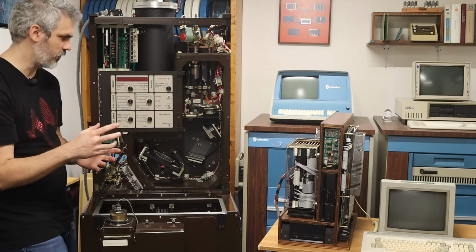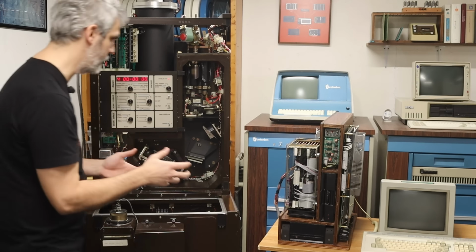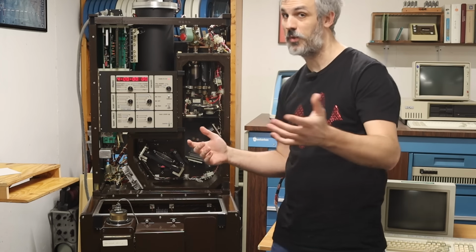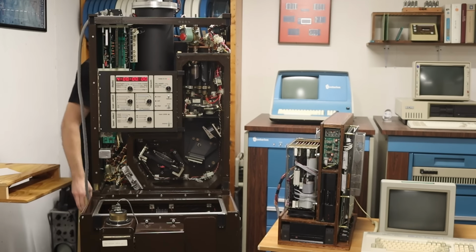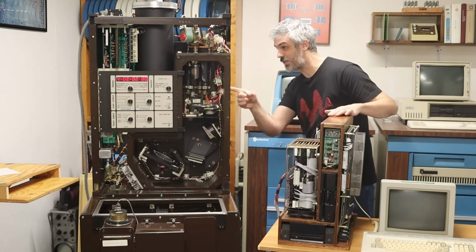It's going kind of crazy. There it goes. You can see it. It's going crazy again. The monitor is on. If I can turn it off, but that didn't seem to make a difference. It did it once before with the monitor. What is going on? Yeah, there it goes. I'm not crazy. It did it once there.